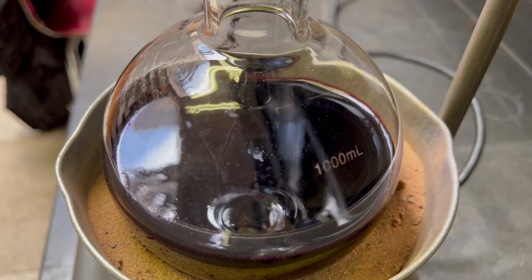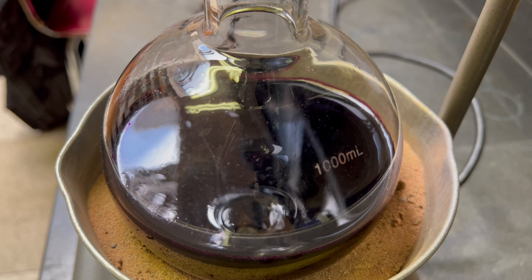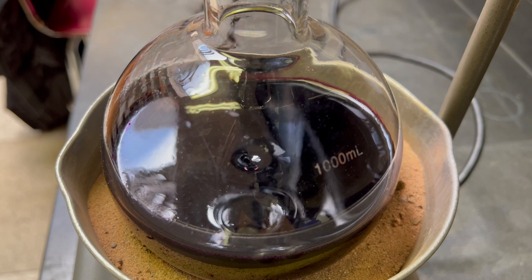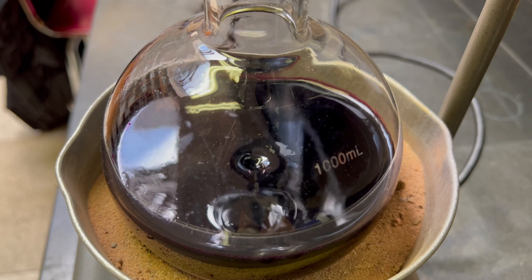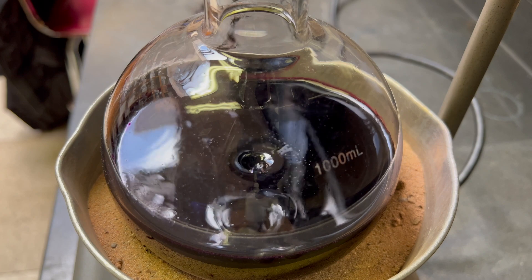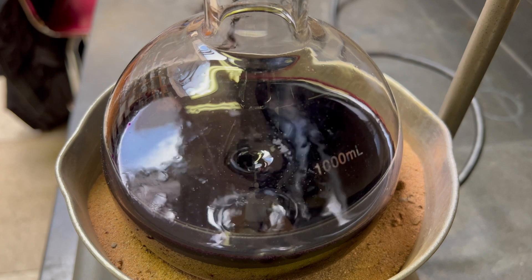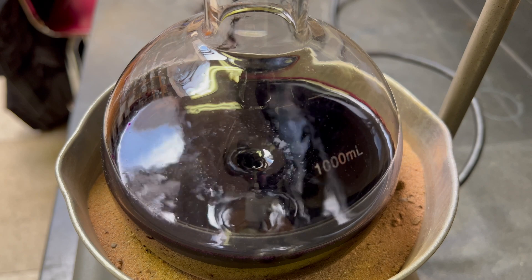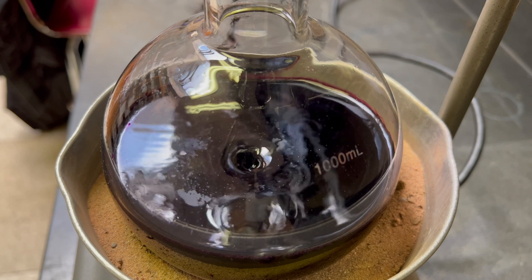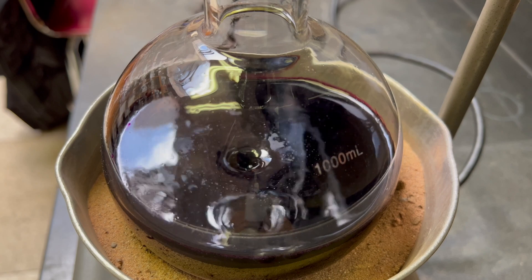Proper stirring is crucial, and in my experimentation the yield will be meager without the proper stirring. We carry out the reaction at elevated temperatures with a reflux. The addition of a few boiling stones is unnecessary but can be handy. Boiling stones will help prevent bumping in the solution during the reflux process. Bumping is a common occurrence in this reaction and should be watched for.